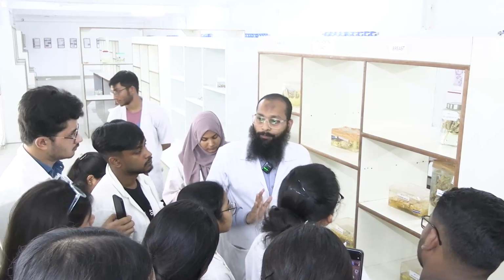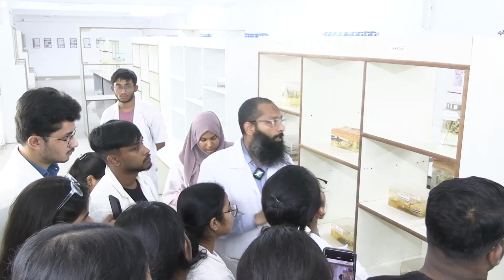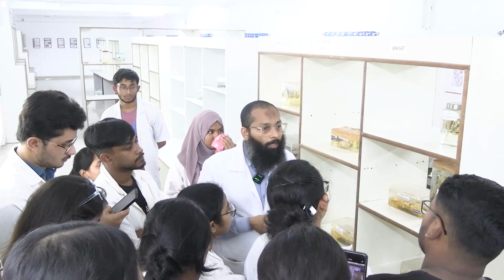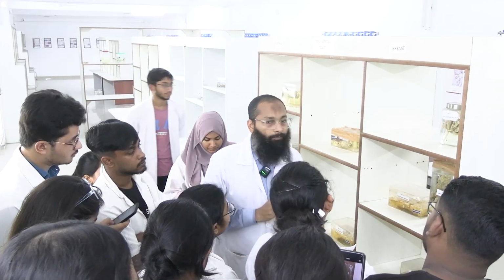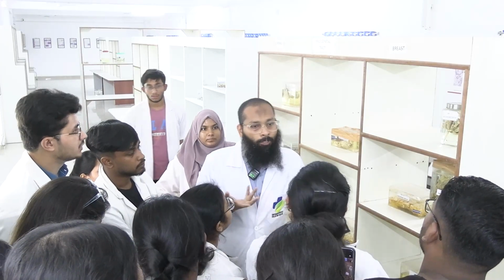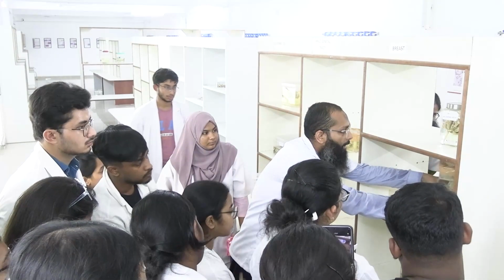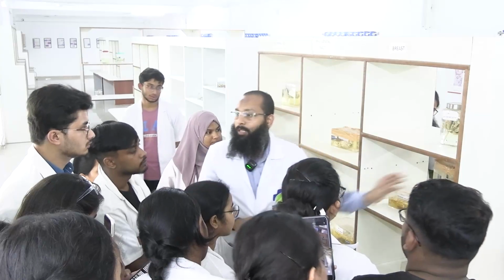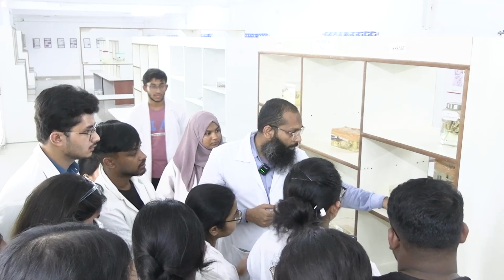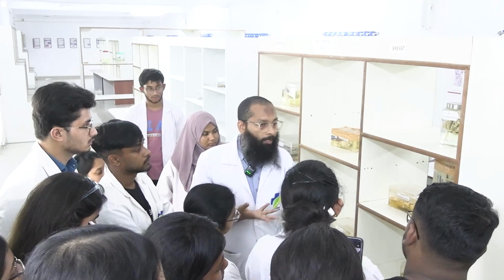Okay, now in the breast, what are the clinical features which the patient takes to you? Lump. Okay, very good. That is the most common feature. Redness with swelling, pain, the lump or swelling, nipple retraction is there here. What else can there be? Bloody nipple discharge, these are the symptoms. Peau d'orange change is not so evident here.